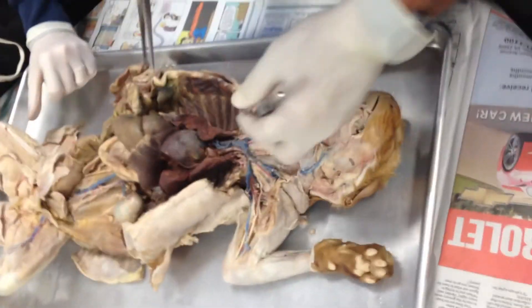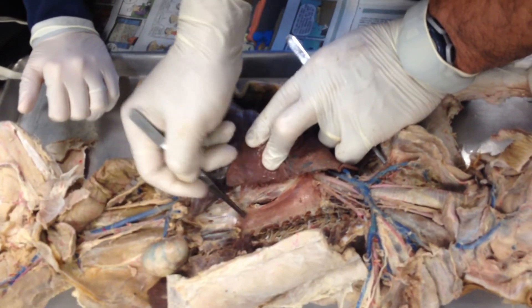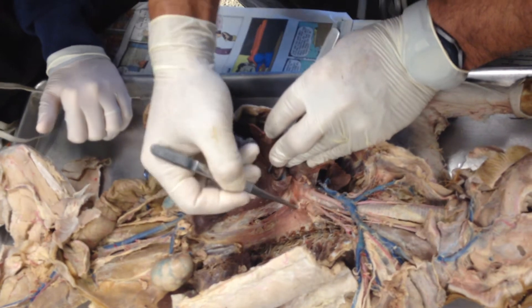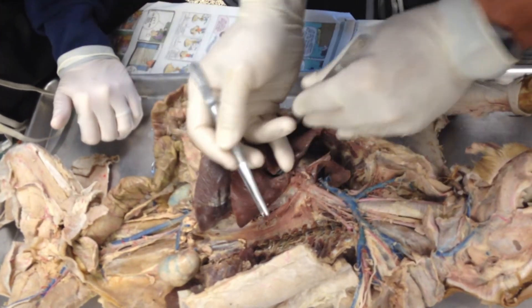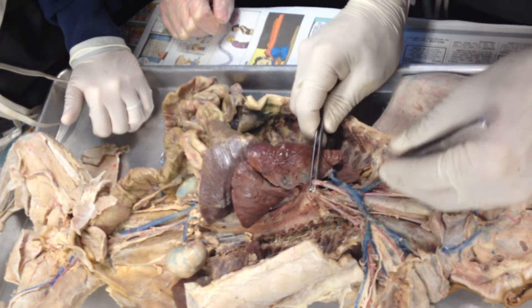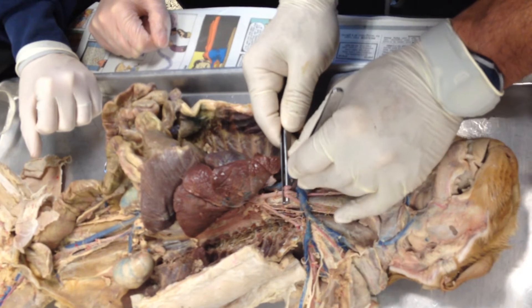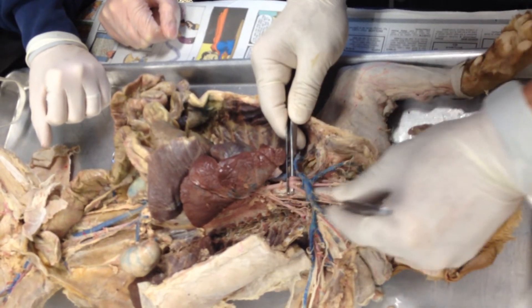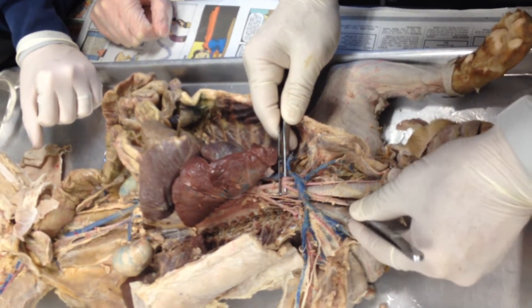Now let's do the arteries. There's the aorta, and the aorta comes and forms the aortic arch right there. We see the two major branches: the first one is the brachiocephalic artery, and the second one is the left subclavian right there. The brachiocephalic has three branches: the right subclavian into the right arm, the right common carotid artery, and the left common carotid artery. Notice nicely against the carotids we can see the vagus nerve branches right there.